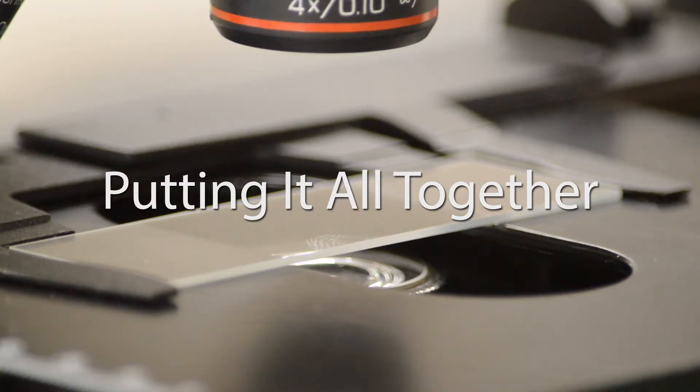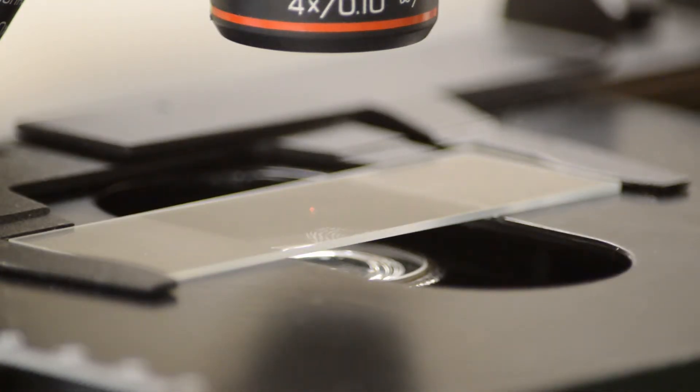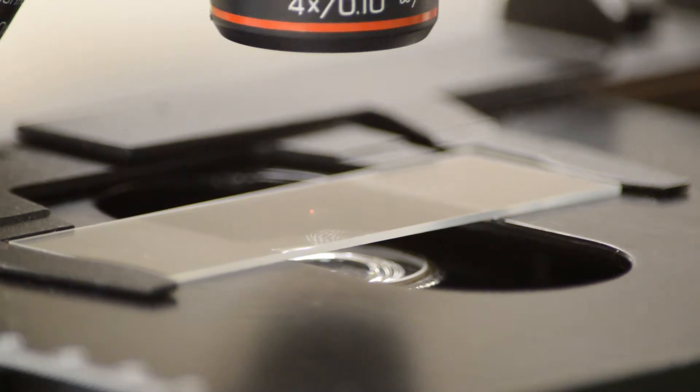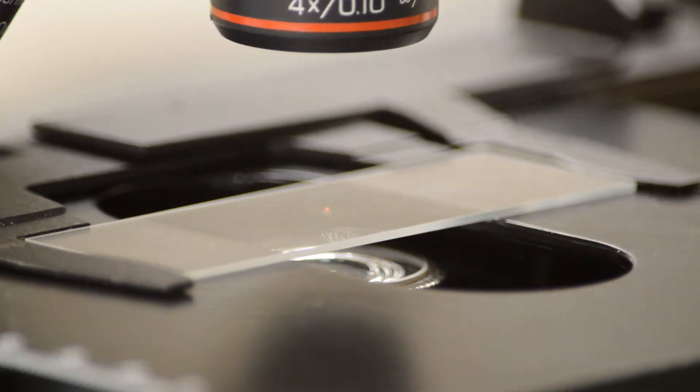When we put all of these parts together we put the slide on the stage. We take the stage, we place the stage as far up as we possibly can. Again we have our 4x objective.